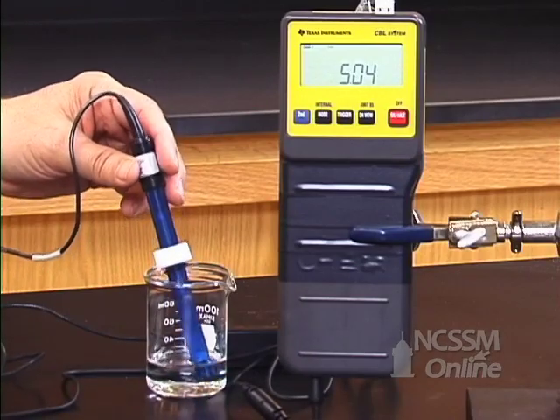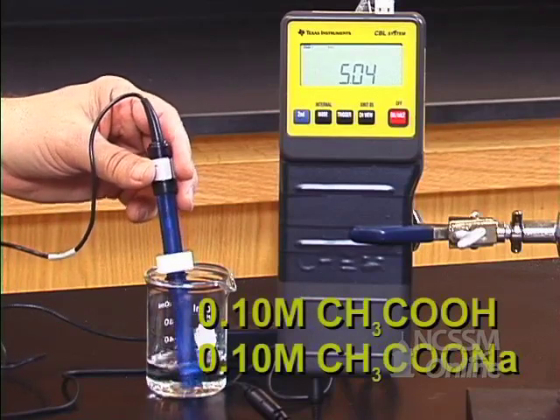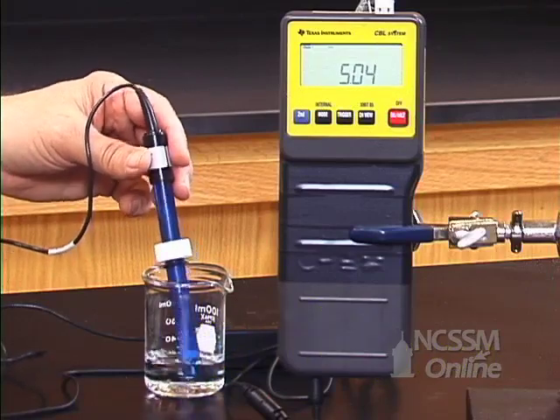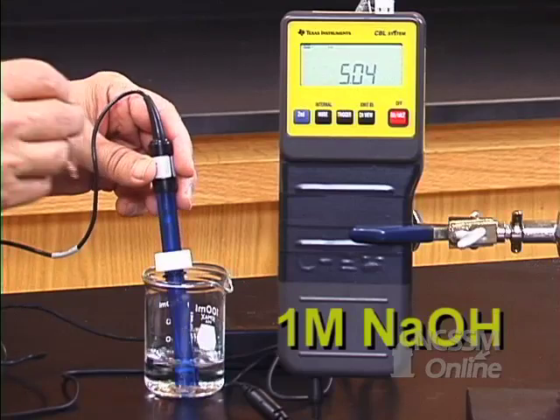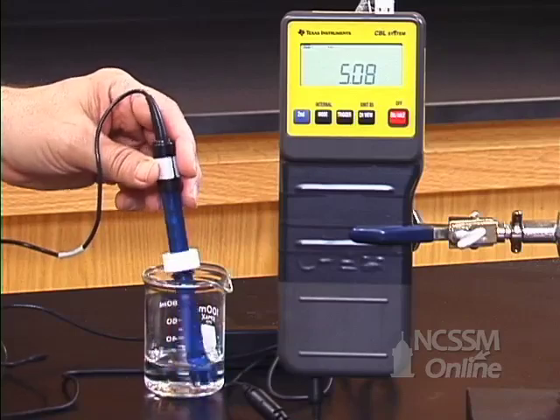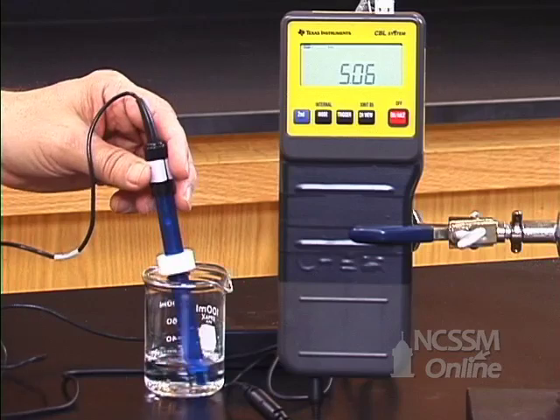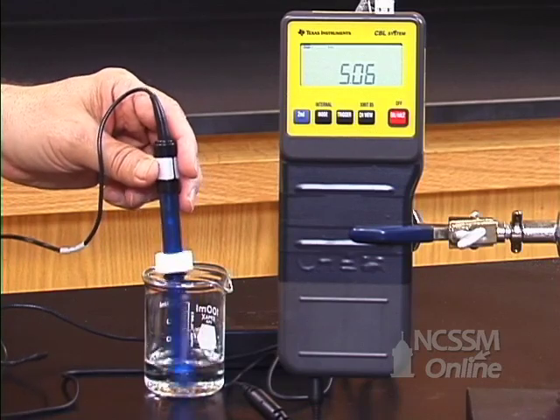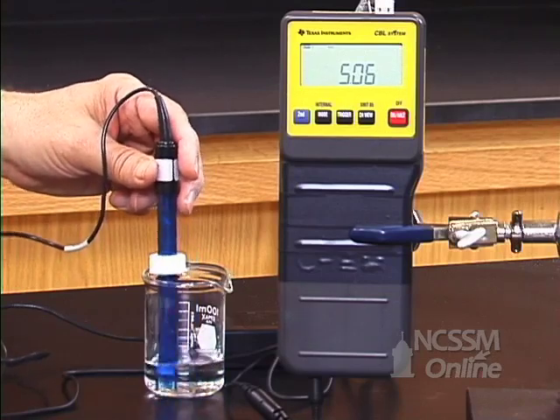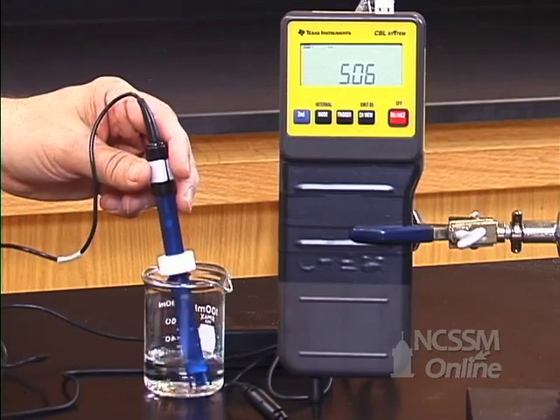I have a new solution of the 0.1 molar acetic acid, 0.1 molar sodium acetate buffer solution. I'm now going to add sodium hydroxide to it. Notice that after adding about three drops of sodium hydroxide, the pH is essentially unchanged. The pH would have risen very rapidly with pure water.